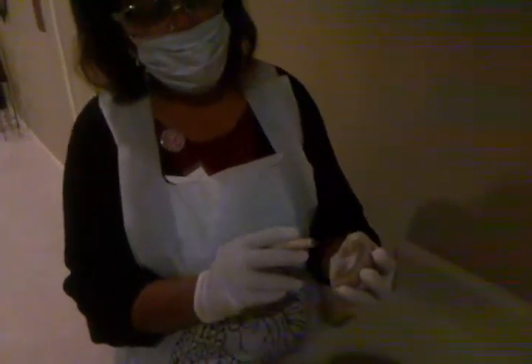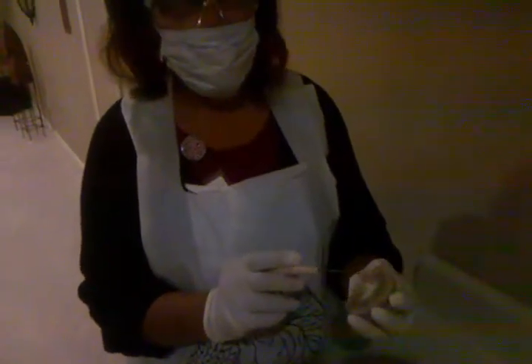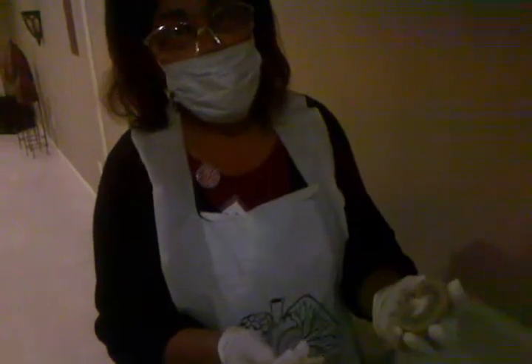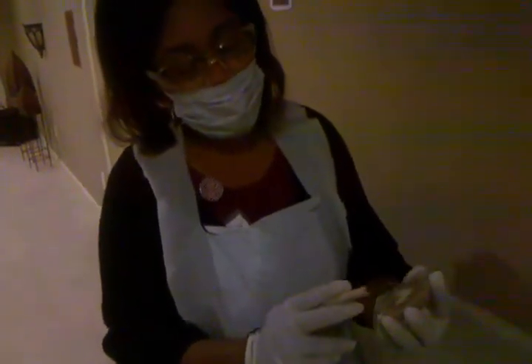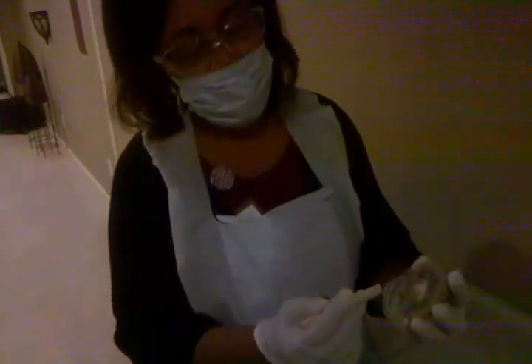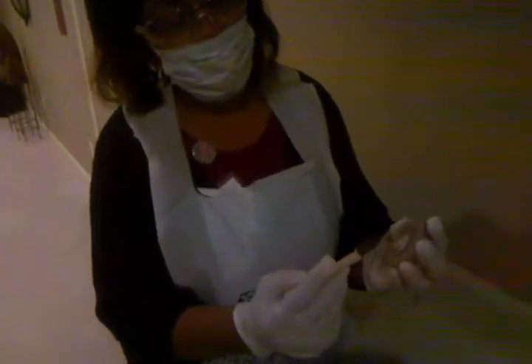It's really hard to see here. When I did research online and looked in the books, they appeared to be rounder structures, versus this right here, which seems like one ongoing structure. But they're little round areas that kind of form a triangle. In between our renal pyramids, there is cortical tissue which separates each one, and that area is called the renal columns. There should be a few around here, although it's really hard to tell. I think we might have one here, and one here. Okay, and those are our renal columns.